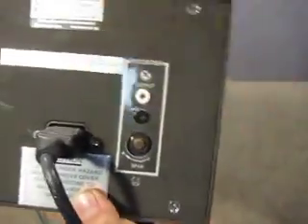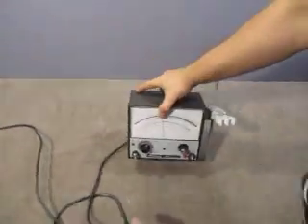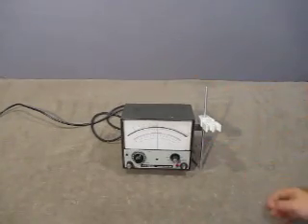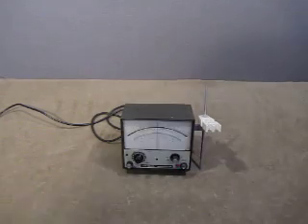There's a recorder and a span button and some other stuff on the back. I don't have the proper stuff to test it with, but I'll plug it in and we'll turn it on.